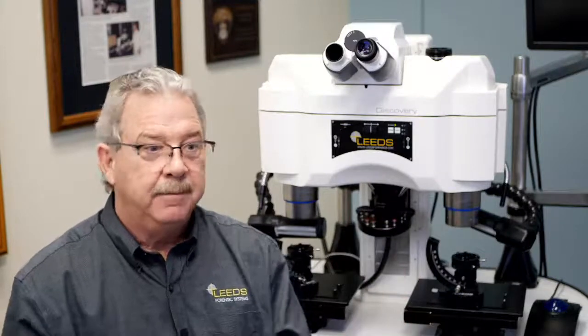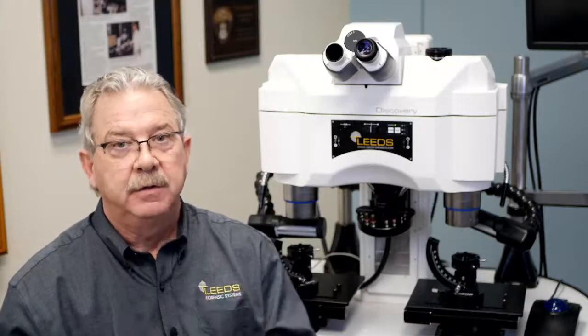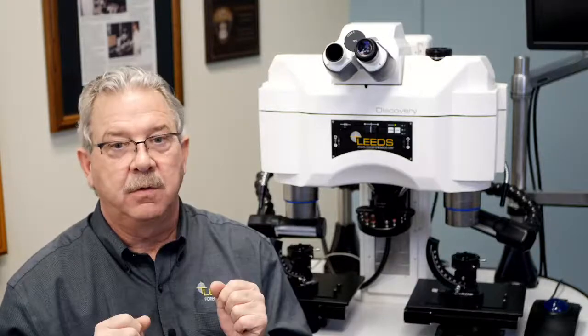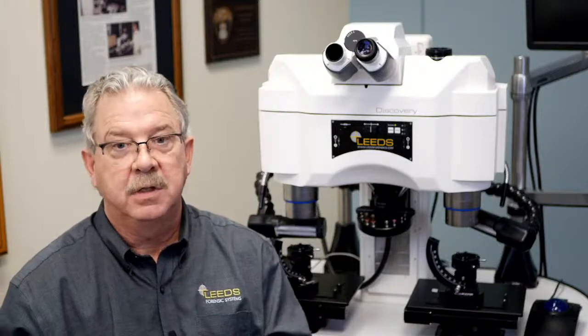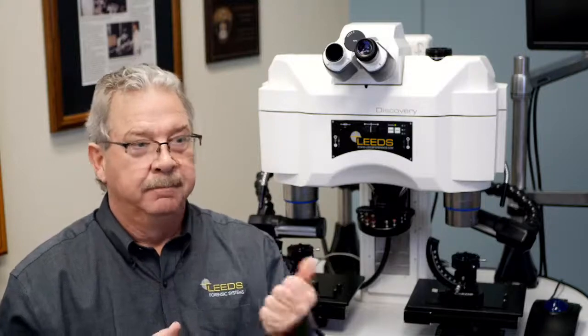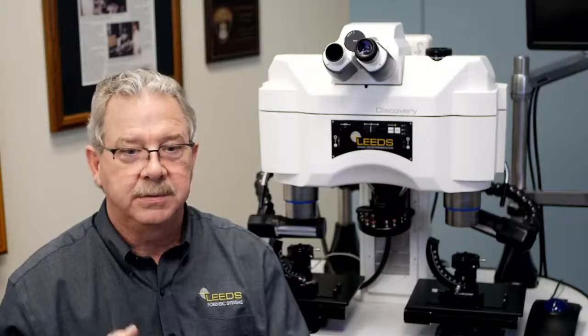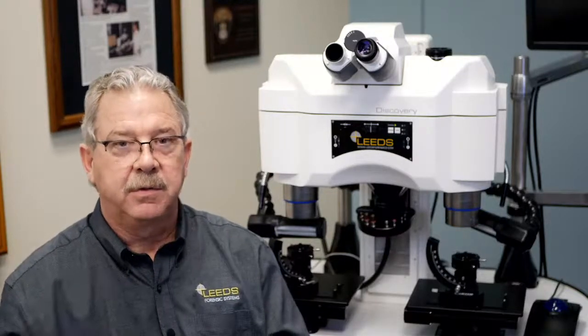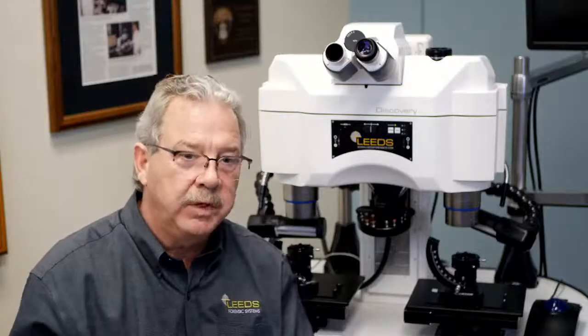That's really all I have for today. Hopefully that gives you some insight. Basically, a larger field of view number on our eyepiece is going to provide a larger field of view at a given magnification than an eyepiece with a smaller field of view number. So if you've got a choice, 22, 23 millimeters, go for it. It's going to make your inspections easier. Typically, these are also the most modern designs of their eyepieces for most manufacturers, so therefore we again get that best eye relief and the most relaxed zone for where we need to place our eyeball.